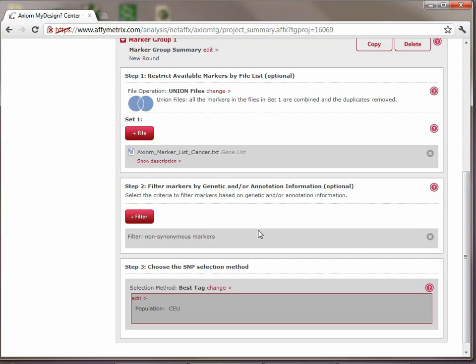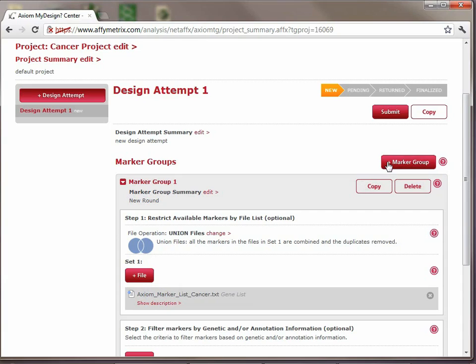Okay, so now we need to create the second marker group to look at the low minor allele frequency genes, or the markers in low minor allele frequency in the cancer-related genes. So there's two ways you can go about doing this. The first is you could click the plus marker group, which will create an empty marker group, and then you can go about adding the file again and then adding the filter. Or you can take this cool little shortcut, which is copy. So this will copy the exact version of this marker group.